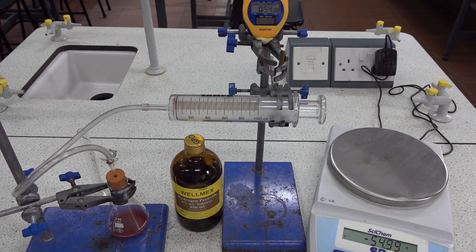So once more we have no accelerated decomposition of the hydrogen peroxide that we can measure in the same time frame.